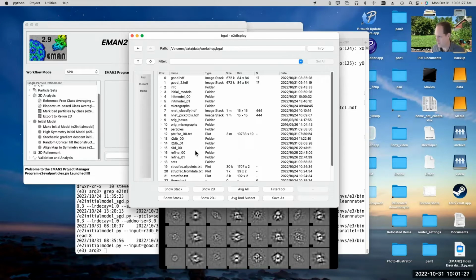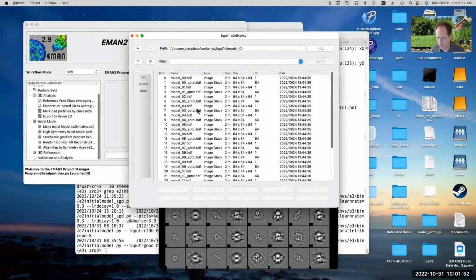I don't recommend normally just skipping it entirely. Usually you want to do the 2D class averaging just to get a feel for what the different orientations of your particle actually look like, given that the raw particles are often pretty noisy looking. So even if I'm not going to use it for the initial model, I'll usually still generate these class averages. But for making the initial model, you can actually just use the raw particles with this. And most of the time, it'll work pretty nicely.